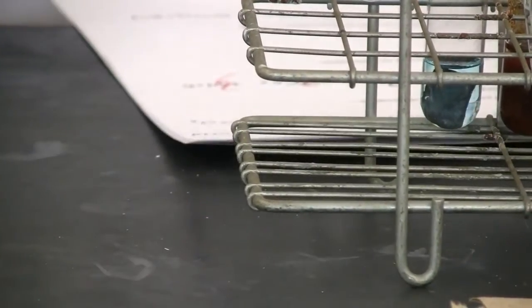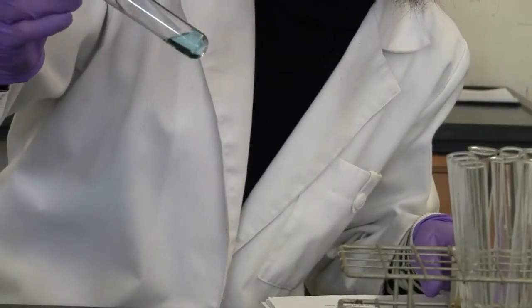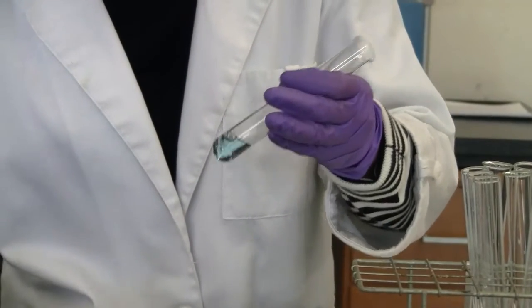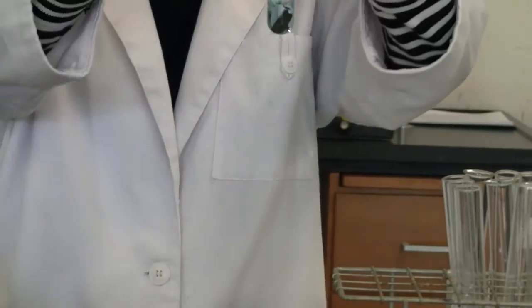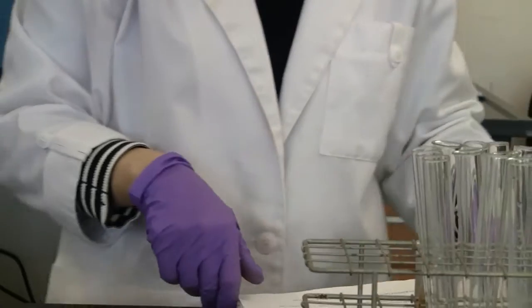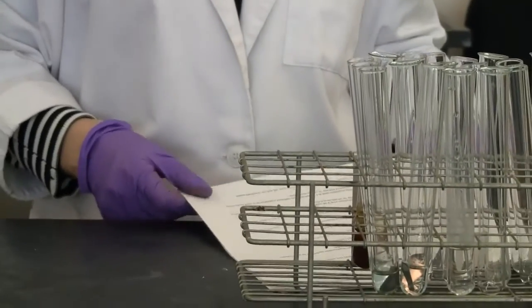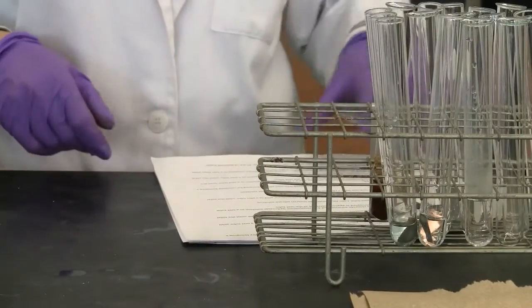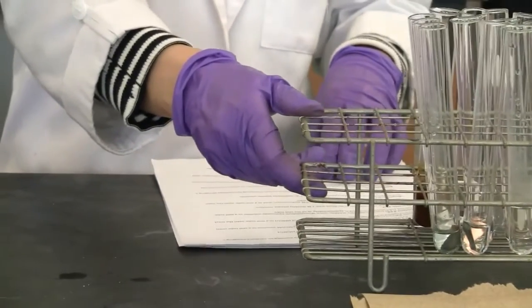Okay. Now let's go back to our reaction 13. Okay, watch carefully. It's a little bit hard to observe. Maybe we'll revisit that even later, let the reaction develop. I'll leave that in the corner. Okay, remember, reaction 13 we needed to observe later. Now move to reaction 15.